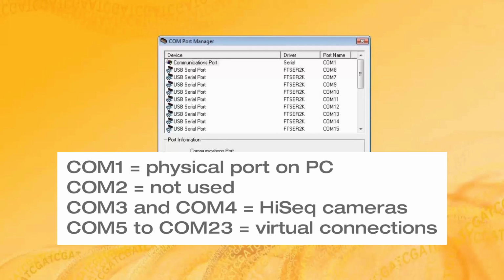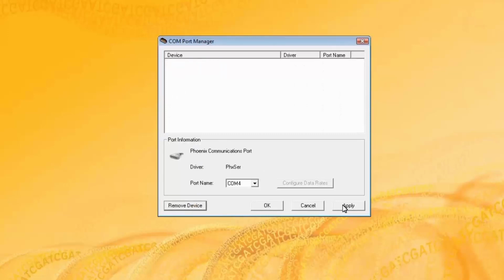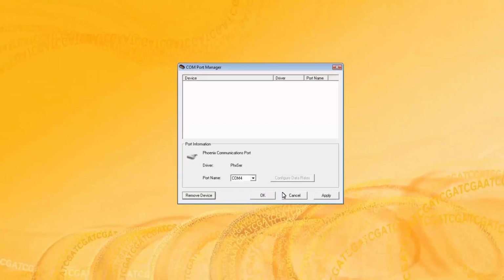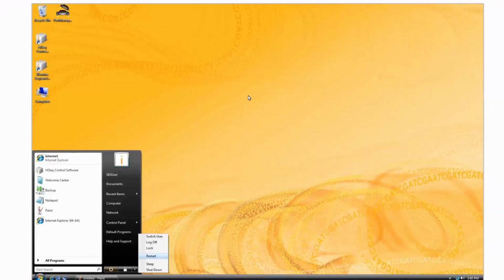COM1 is a physical port on the PC. COM2 is not used. COM3 to 4 connect to the HiSeq cameras. COM5 through 23 are virtual connections claimed by devices when the HiSeq turns on. Select each communication port and click Remove Device until all COM ports have been deleted and the box is empty. Click Apply, then OK, then close Port Manager. Restart the computer and wait until boot up is complete. This may take a few minutes.